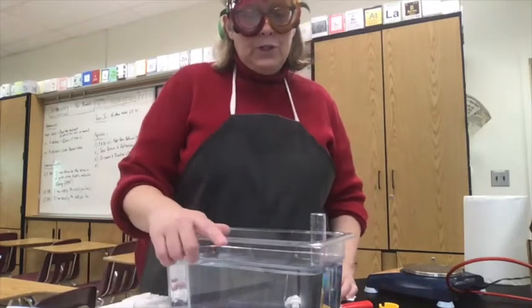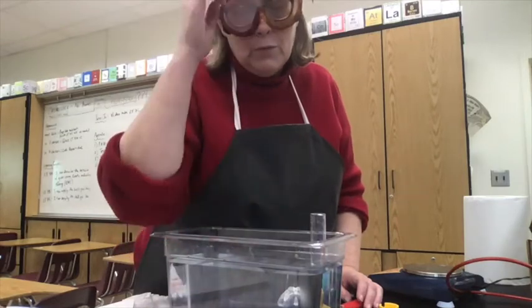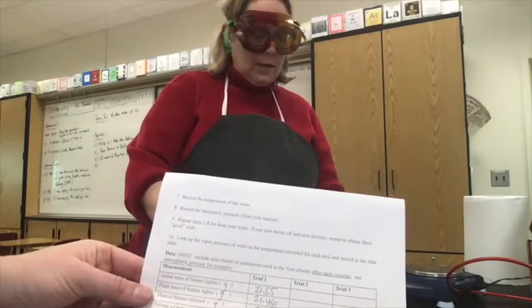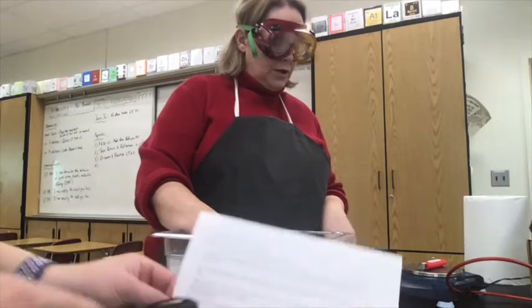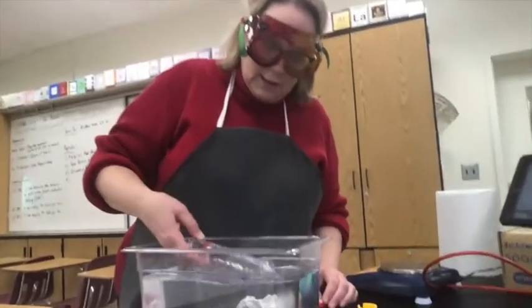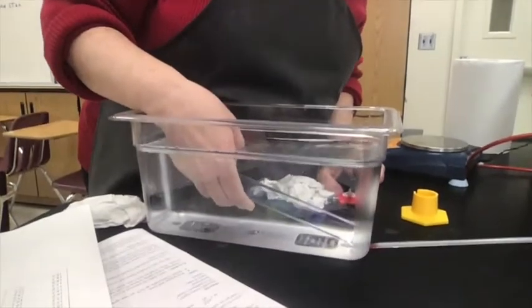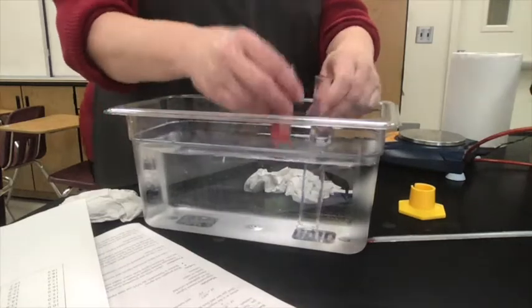But just as a reminder, that final mass of the butane lighter, that 21.46, can be your starting mass on trial 2. You don't have to remeasure it. We're going to assume that it was all fine to start with, and the final mass becomes the new starting mass. But now I do need to go back and fill my tube up, make sure I don't have any air bubbles in it. I see an air bubble. And go ahead and collect another sample.